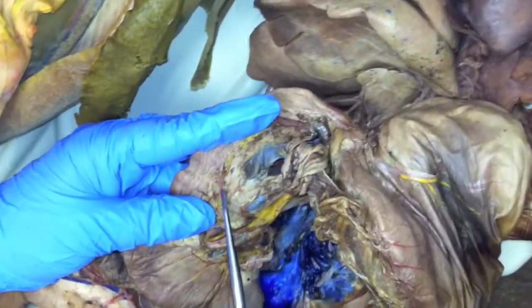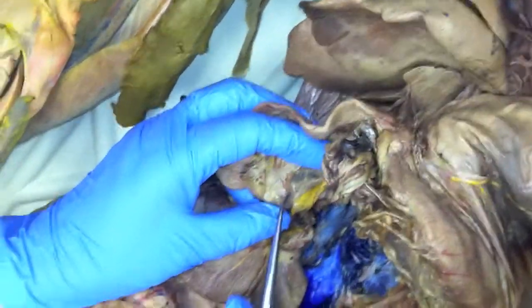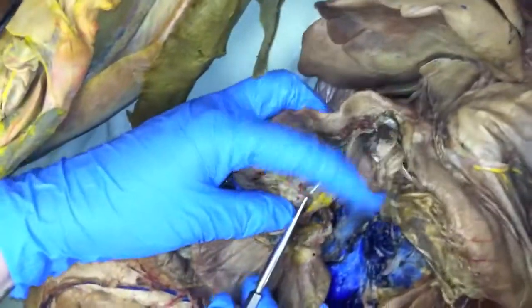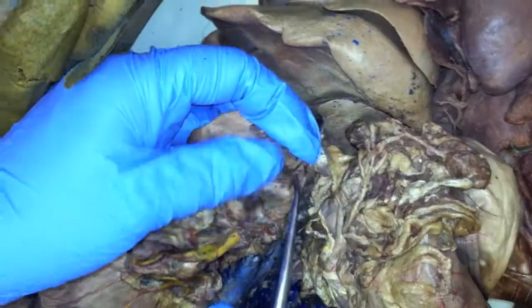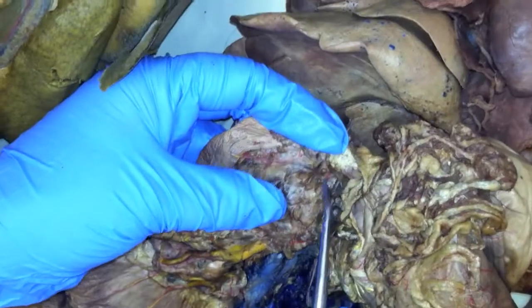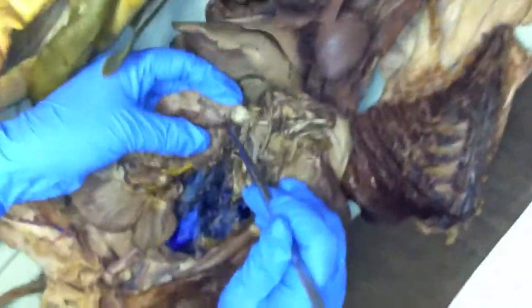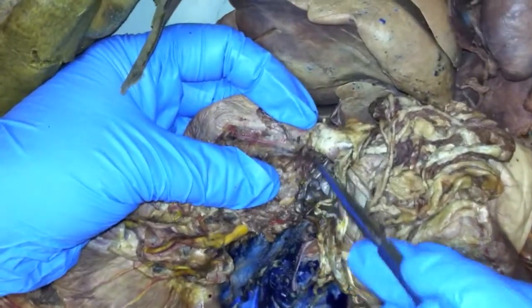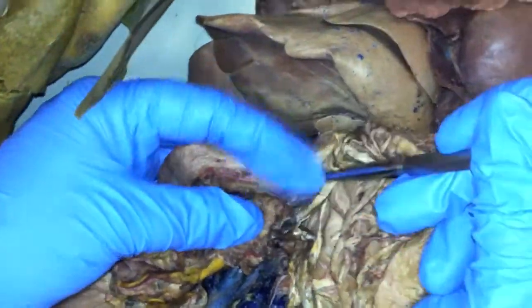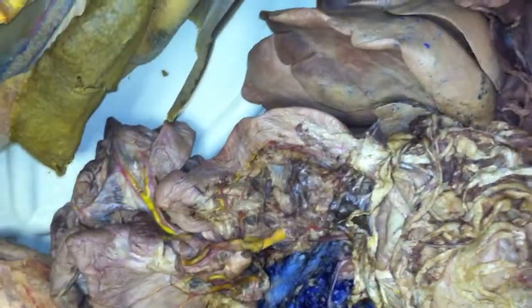So you see this yellow stuff coming through here? There's your posterior pancreaticoduodenal emptying into the cranial mesenteric. What's that dark stuff coming across? That would be the anterior coming through here — anterior pancreaticoduodenal right there. So you see, that one actually runs into the hepatic portal.